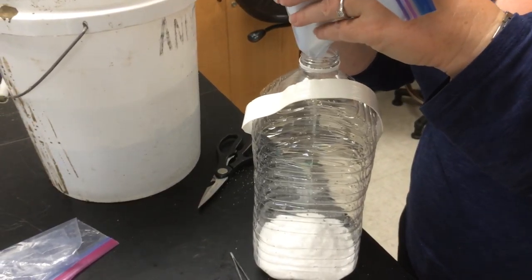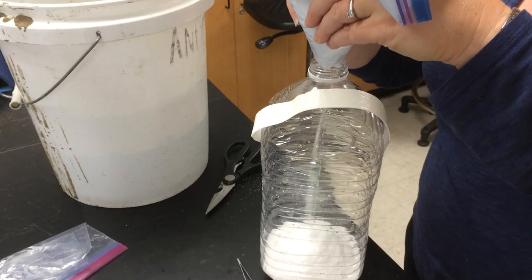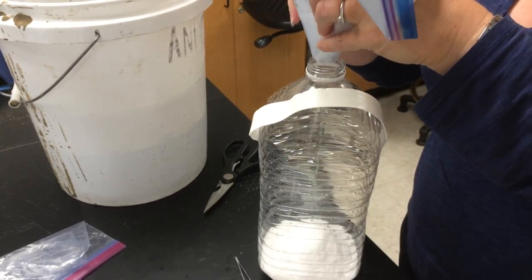What are you doing Claire? I am pouring this measured salt into my very fine glassware. Are you hyper salinating? I'm making a hyper saline solution.